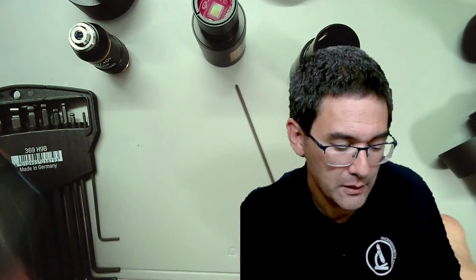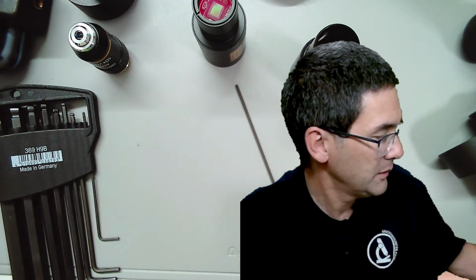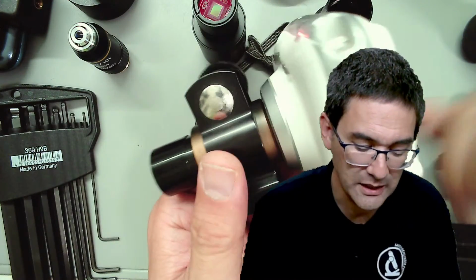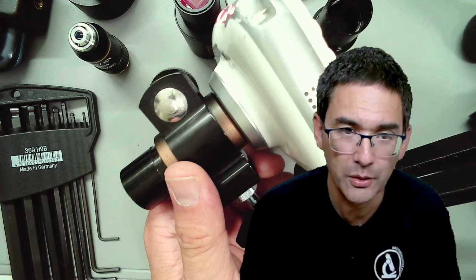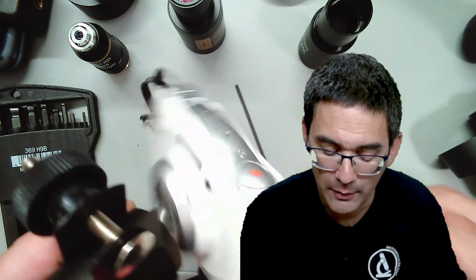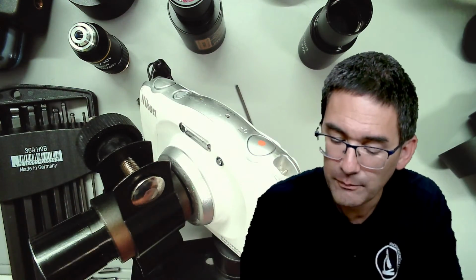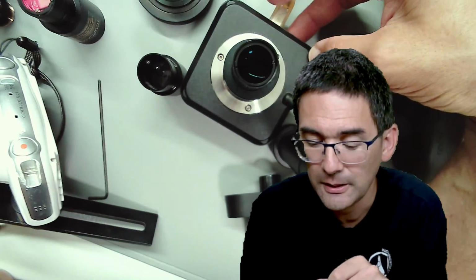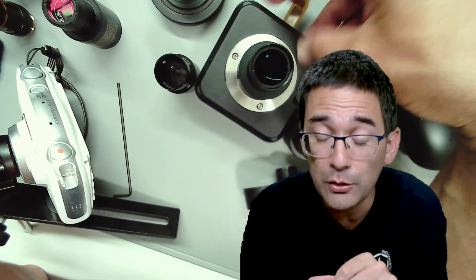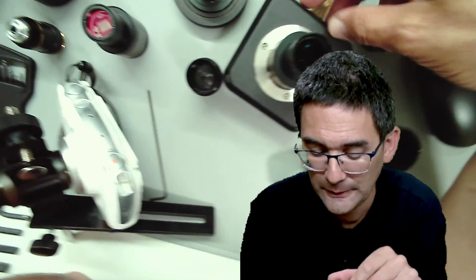If you have a compact camera, then you might try a solution like this one over here, which is kind of difficult to get, but maybe there are some clamps where you can assemble something yourself. Or you connect a tripod. In most cases, most people will actually use a microscope camera like this here, because it's convenient and easy to use, with the disadvantage of limited video ability because of the USB connection. Or you try to get those cameras with USB 3, but unfortunately they're significantly more expensive.